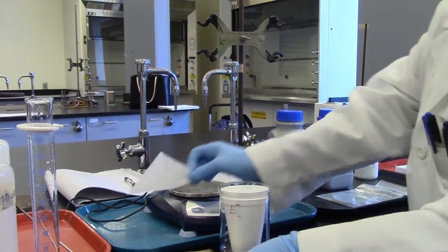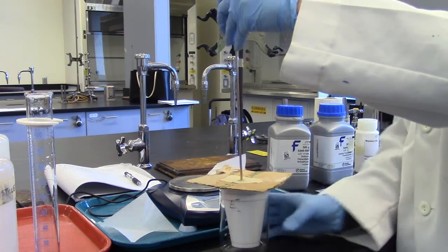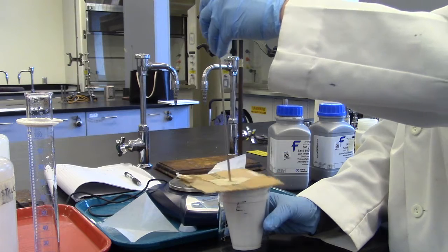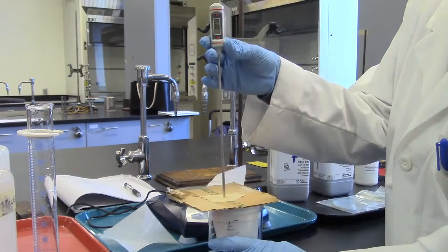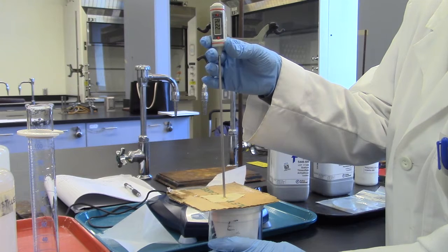Cover and stir. Be mindful that you don't poke a hole in the bottom of the calorimeter. Once the temperature has stabilized, record the final temperature in your notebook.